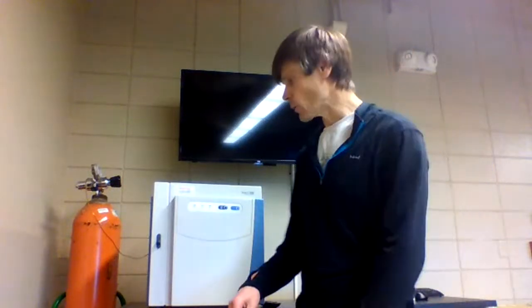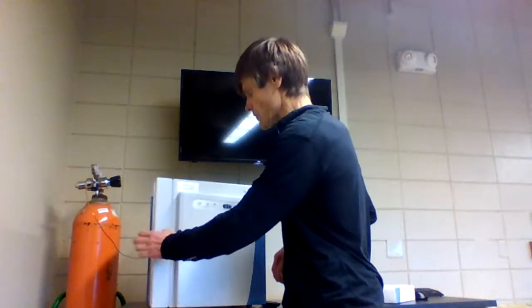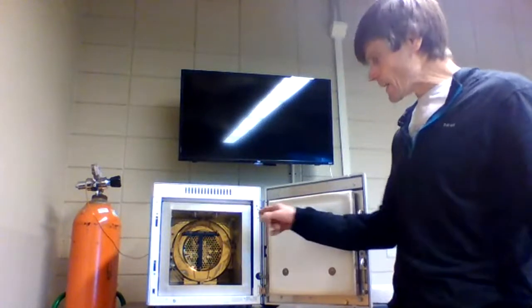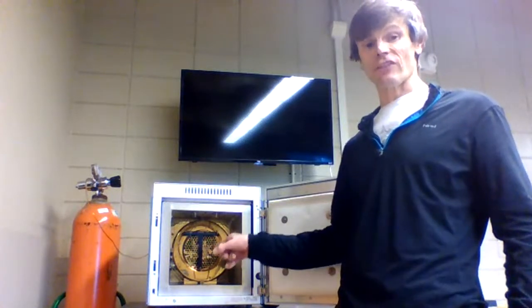Now, for working in a research lab, or if you were working in lab for this particular experiment, we're going to use an open tubular capillary column. So the columns themselves, whether they be packed columns or the type of column that I'm discussing now, a capillary column, are inside an oven. So I'm going to open the oven up. Here's our oven, and in that oven is where our capillary column is housed.